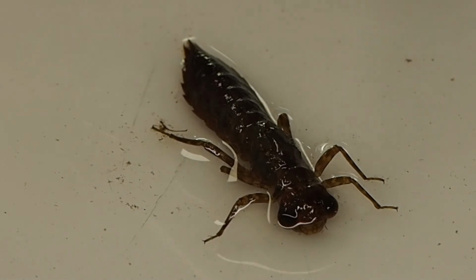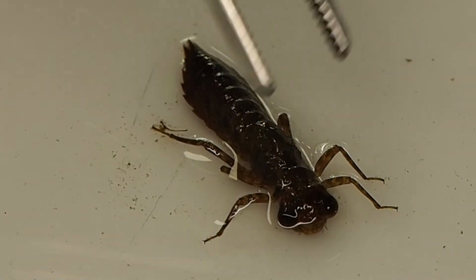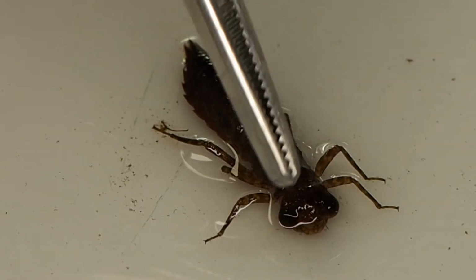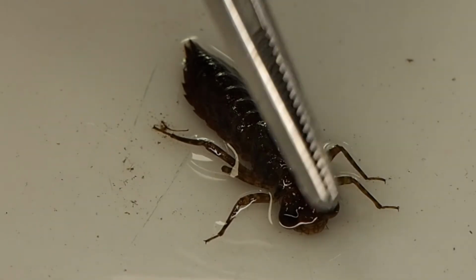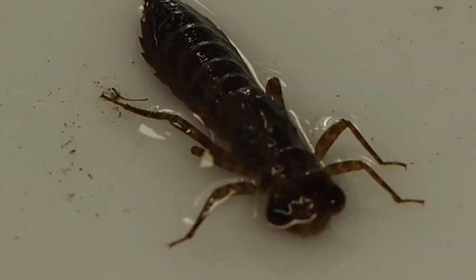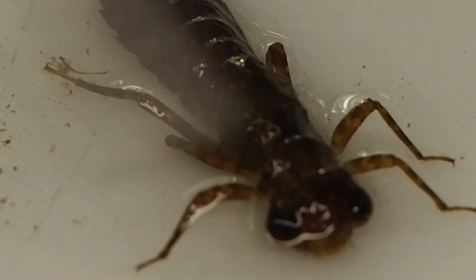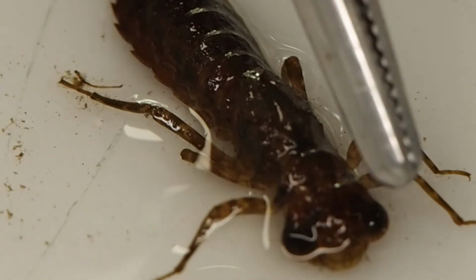and that tells us, one, it's in the Insecta, class Insecta. So other things we can see around the head here, we can see some large bulbous eyes. You may be able to pick up in the image there's some very short antennae there. Some insects have very long antennae, others are short. So this species and this family is known to have very short antennae.